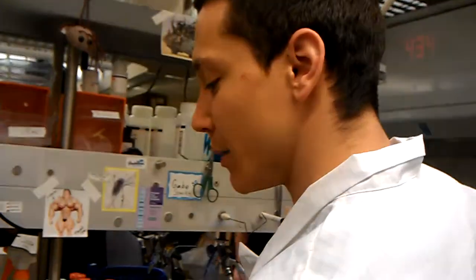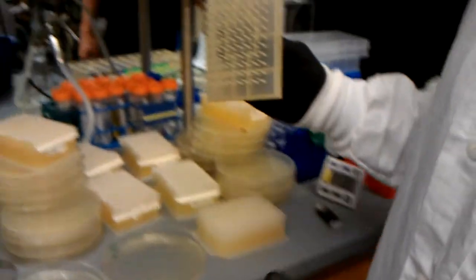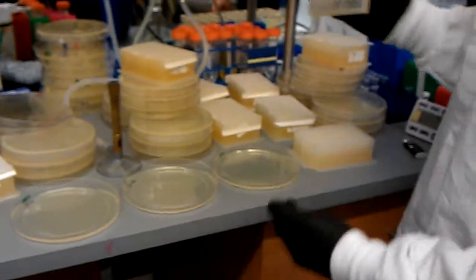So actually, I misspeak. It's not colonies that we're spotting, we're spotting culture. And the idea is we're going to see if we're going to grow up on different plates.